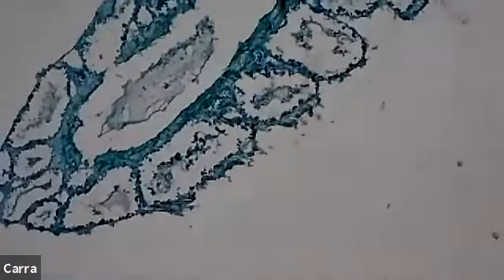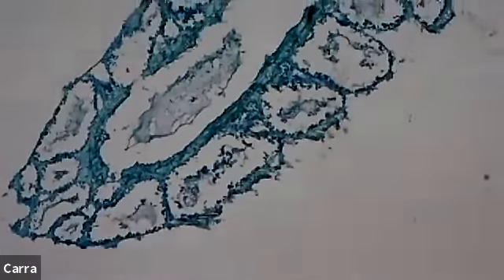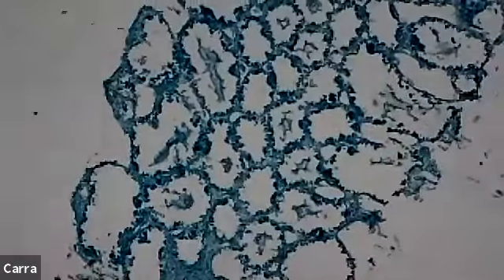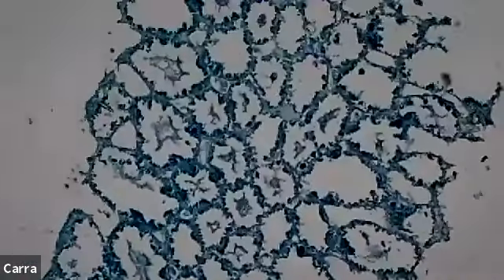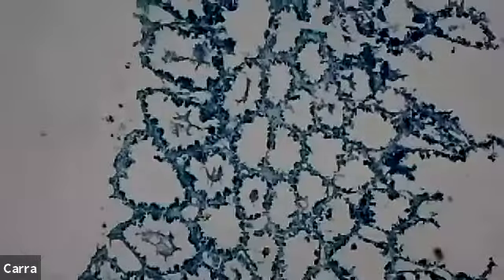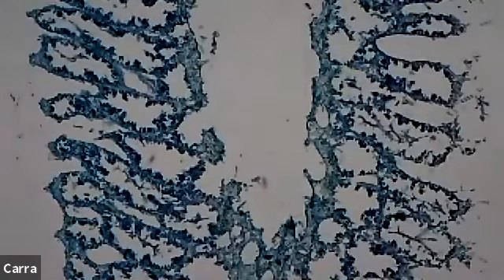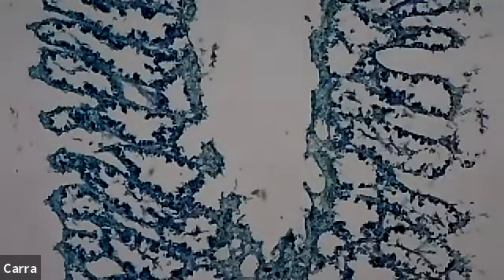This is what would be connected to the substrate down there at the bottom, right? And as we move up, again, nothing really super crazy to look at. It kind of looks like popcorn fluff to me. And that makes sense because the sponge doesn't have true tissues. Sponges are made up of a bunch of different cells that are working collaboratively, but they don't have a true tissue layer. Look on the left and look on the right, you can see how it's zigzagging in and out. Do you see that? That's where you're seeing the pores that the sponge has.